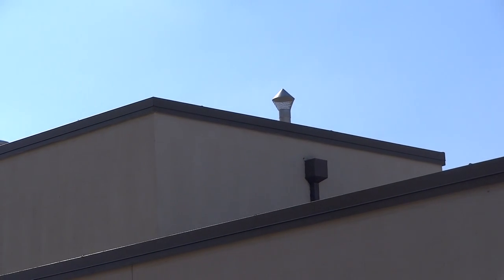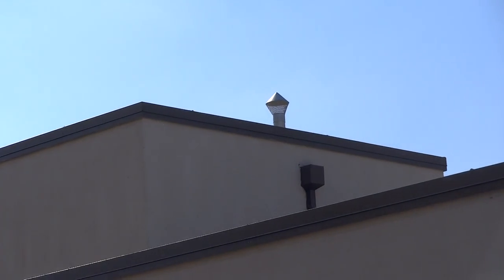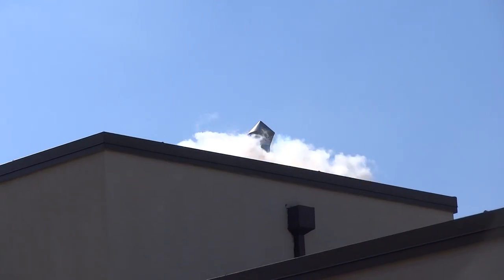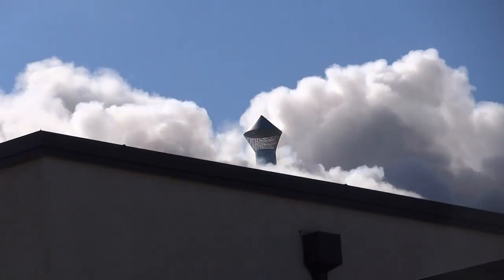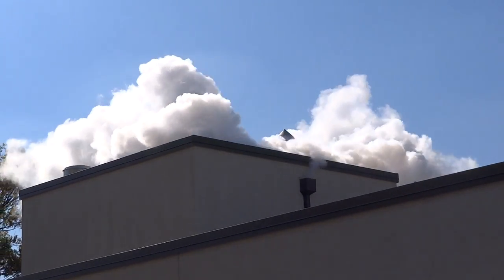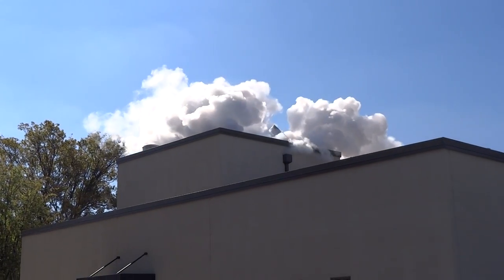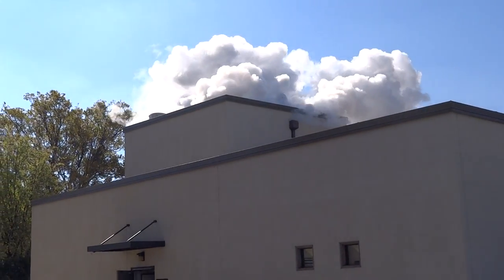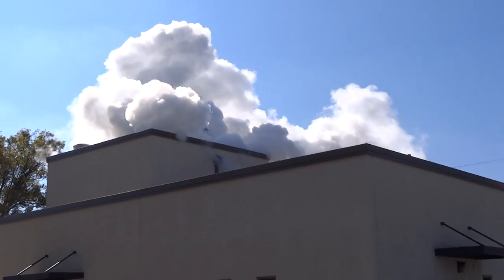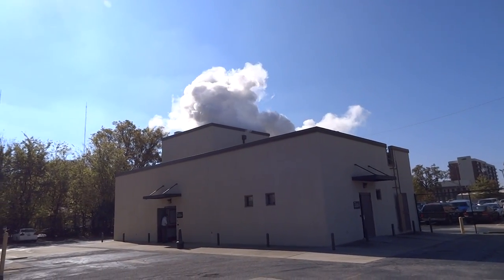That's how it feels to find out. Uh-oh. If it doesn't work, it should look just like this. It worked! What are you doing? Wow. Man. I'm kind of worried why Christina ran back inside.